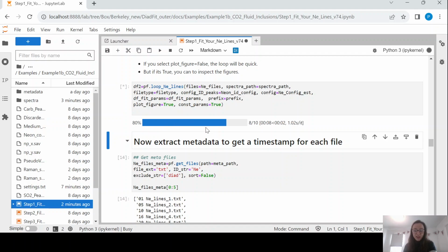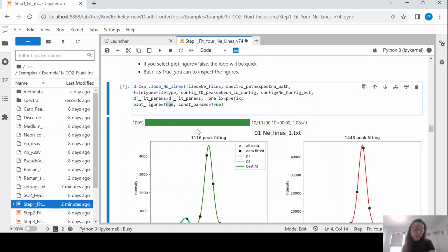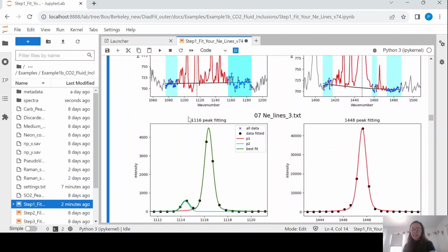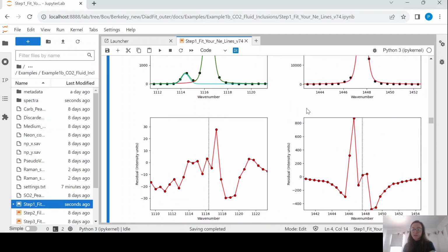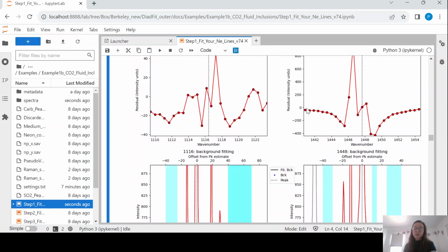So we're just going to let that go. And you can see here it's plotting the figure afterwards, so you're going to be able to look at the peaks. If you have like 70 neon lines, you might want to plot a few of them. If you turn that off, the code will run a lot faster. So I'm just going to flick through, looking at these, the residuals and the background positions, and I am happy with these fits.